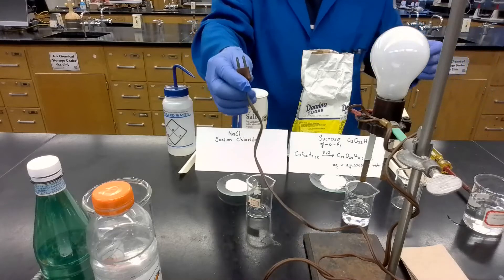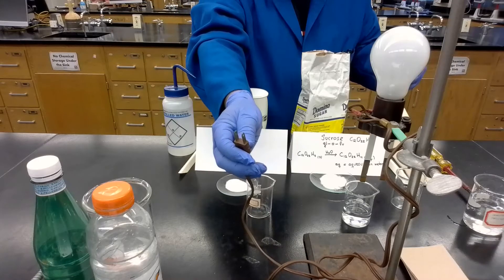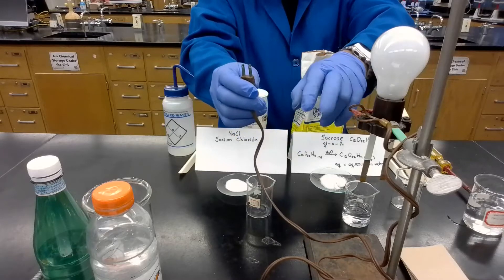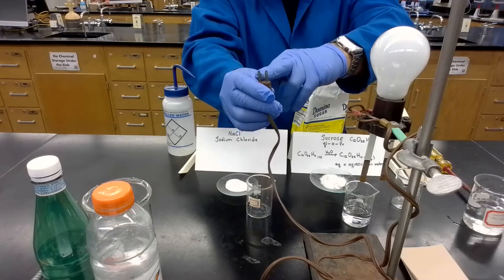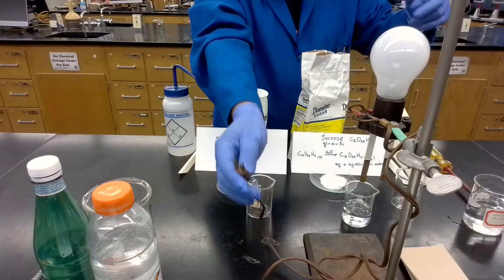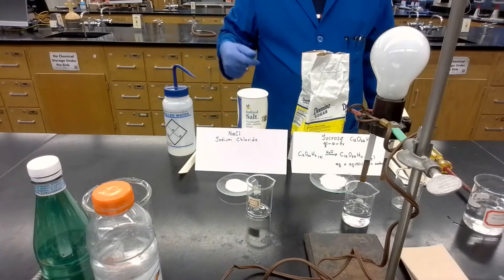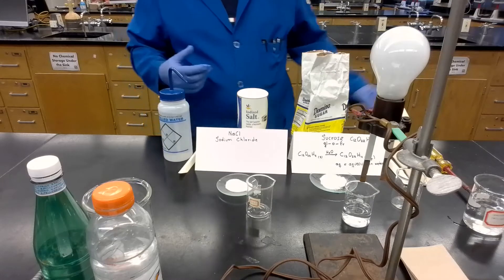In this case, we made a little modification that can be used to test electrolytes and non-electrolytes. One of the terminal wires goes to the terminal of the light bulb, but the second terminal wire goes to this open terminal. That creates an open circuit. So I'm going to plug this into the 120-volt power supply. As you can see, the light bulb is not lighting up — because we have an open circuit.